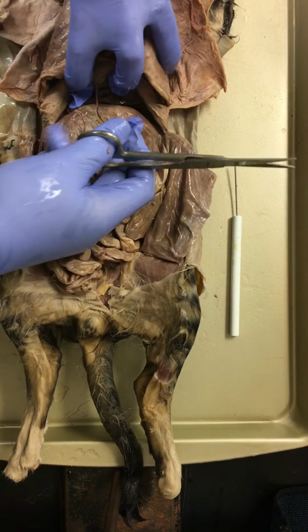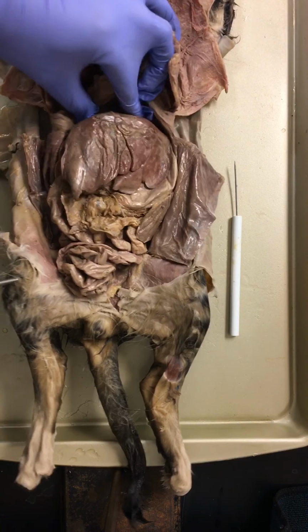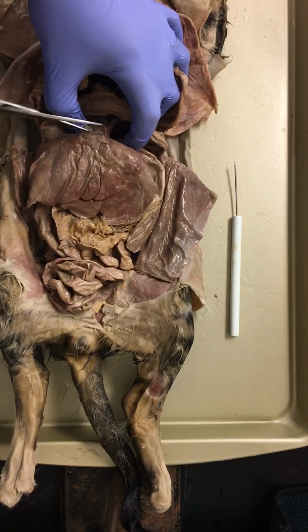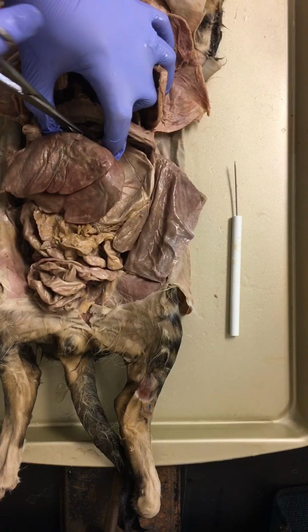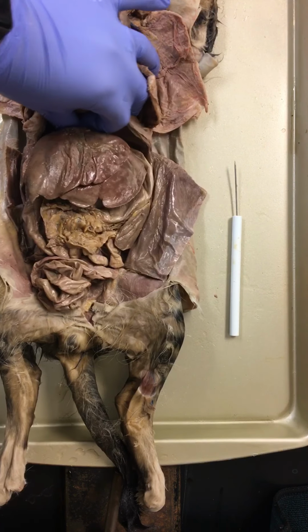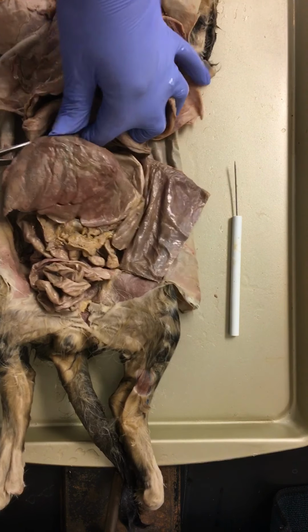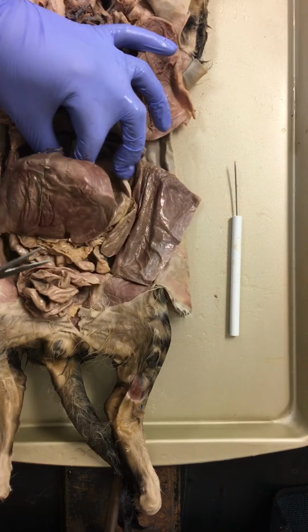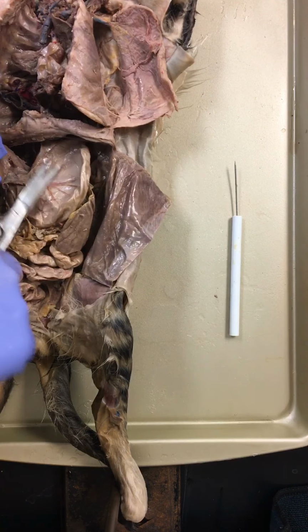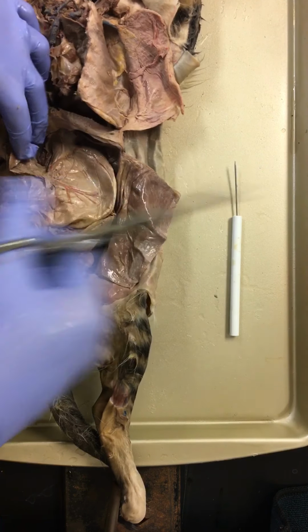So if we go up to the top side here, we can snip. There's connective tissue. On the back of the liver, we're actually going to have some arteries and veins that come down, descending from the thoracic cavity into the abdominal pelvic. Those come off actually pretty quick. And from here, beautiful stomach. We can see the stomach is still connected to the esophagus here.